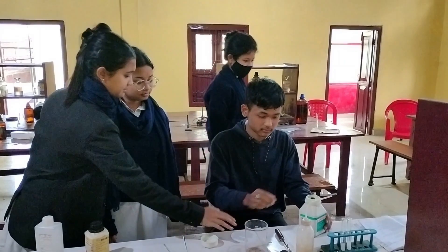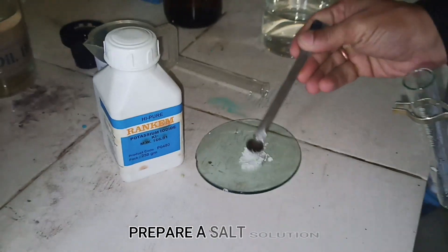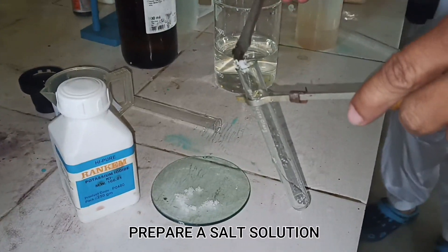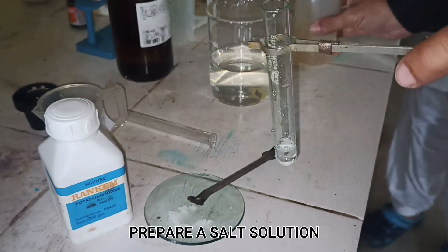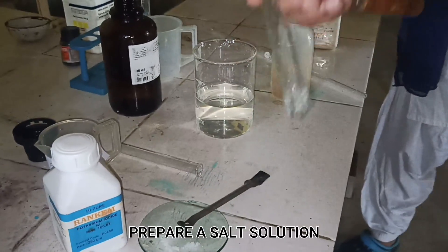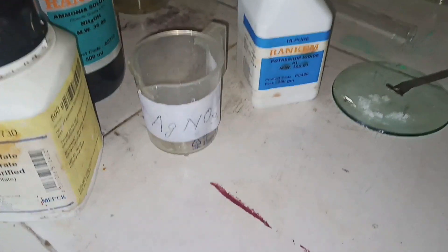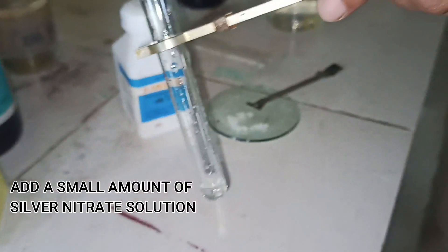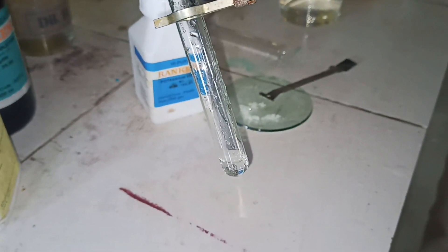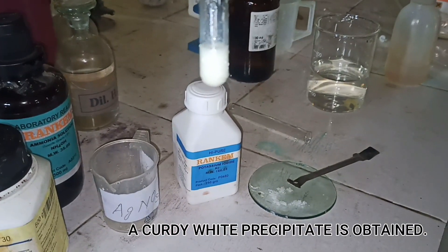For the wet test for chloride, first prepare a salt solution. Now add 1 to 2 ml of silver nitrate solution. If chloride ions are present, a white precipitate will form which is soluble in ammonium hydroxide.